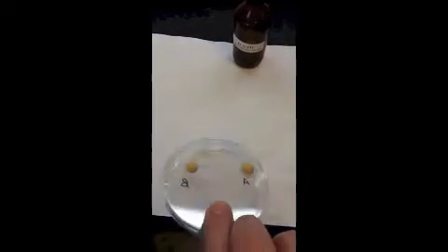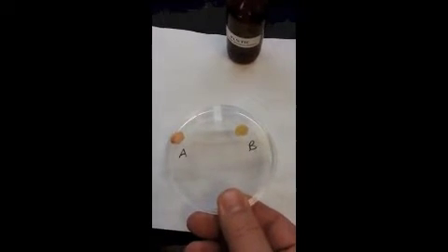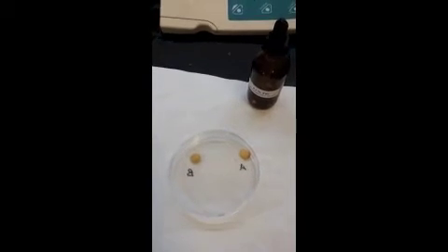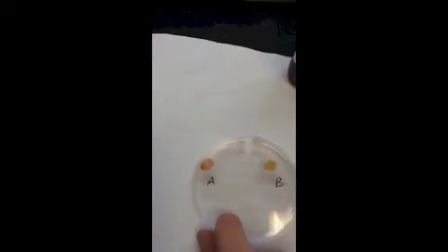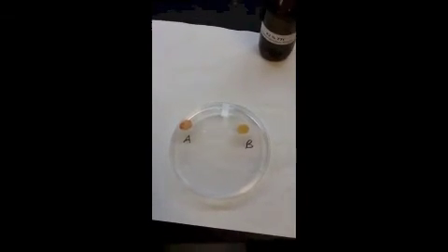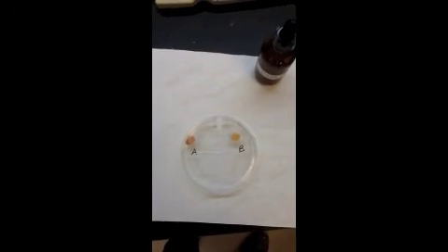Okay, and here we are now looking at these plates at half an hour, after 30 minutes. So again, here's A and B. Okay, and we'll come back and check them out again at 45 minutes. Okay, so now we're going to take a look at these at 45 minutes. So I just flip it over here for a minute. Okay, so that's A and B. Okay, and we're going to take a look at them one more time at an hour. Okay, and so this is our final time point. So these are seeds A and B after 1 hour.